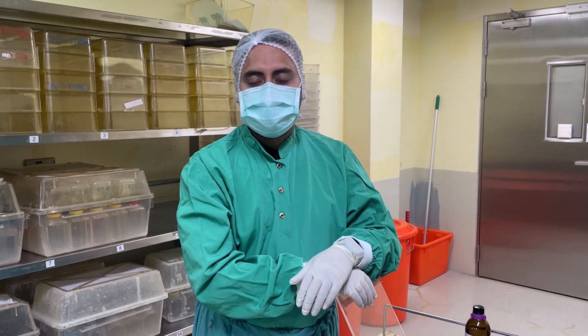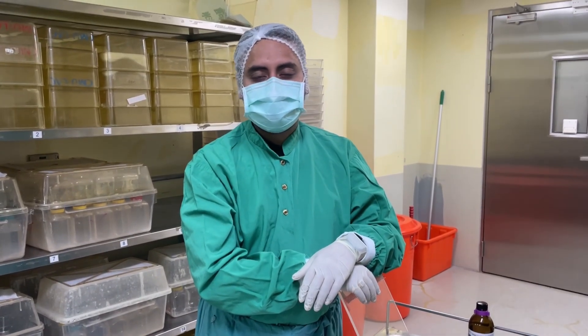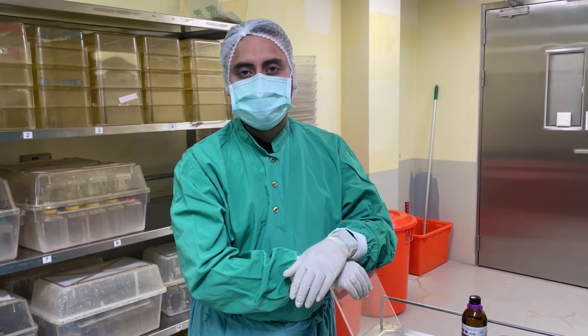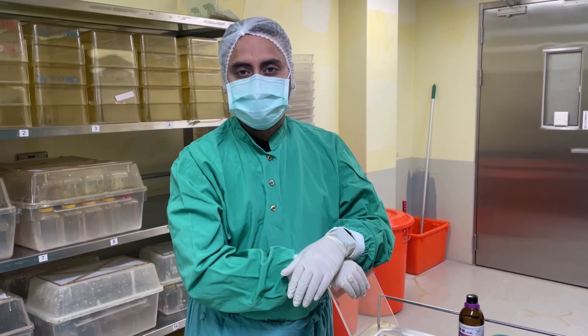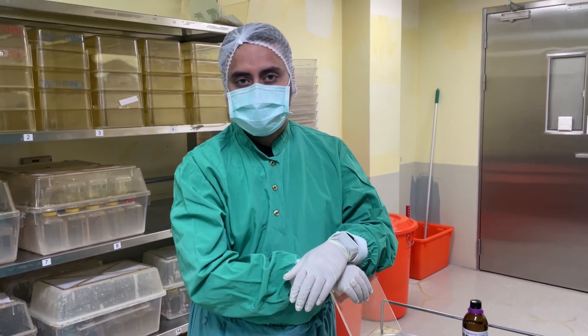Hello everyone, I am Dr. Bhaskar Singh and today we are going to demonstrate how to give a subcutaneous injection to mice.